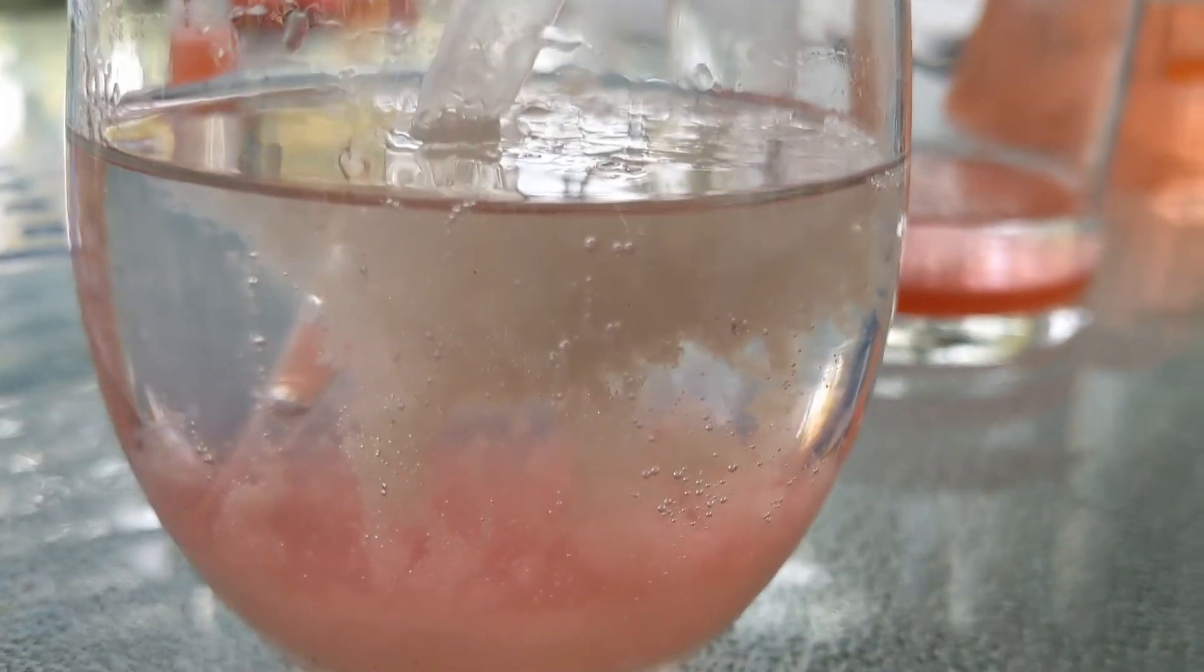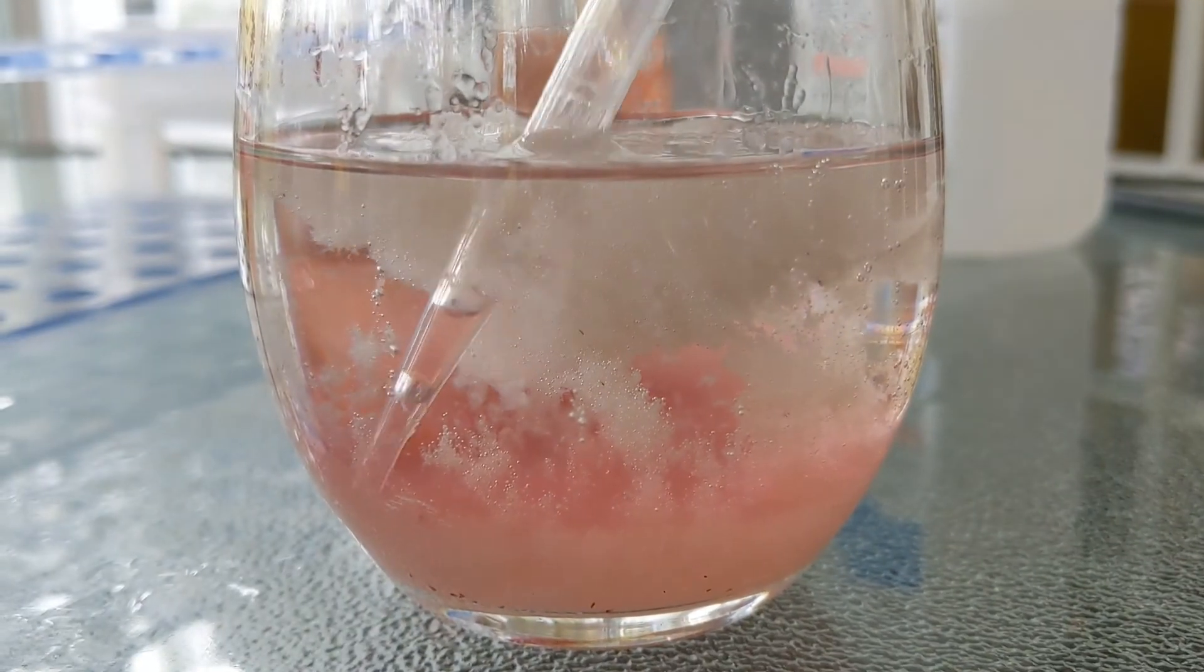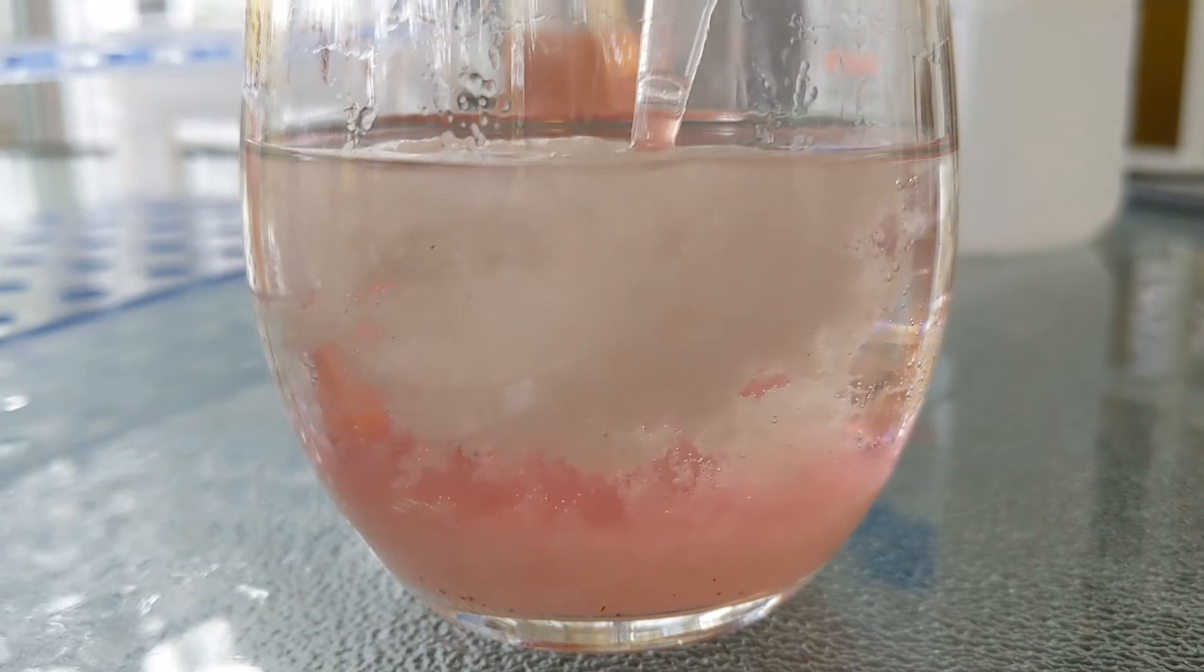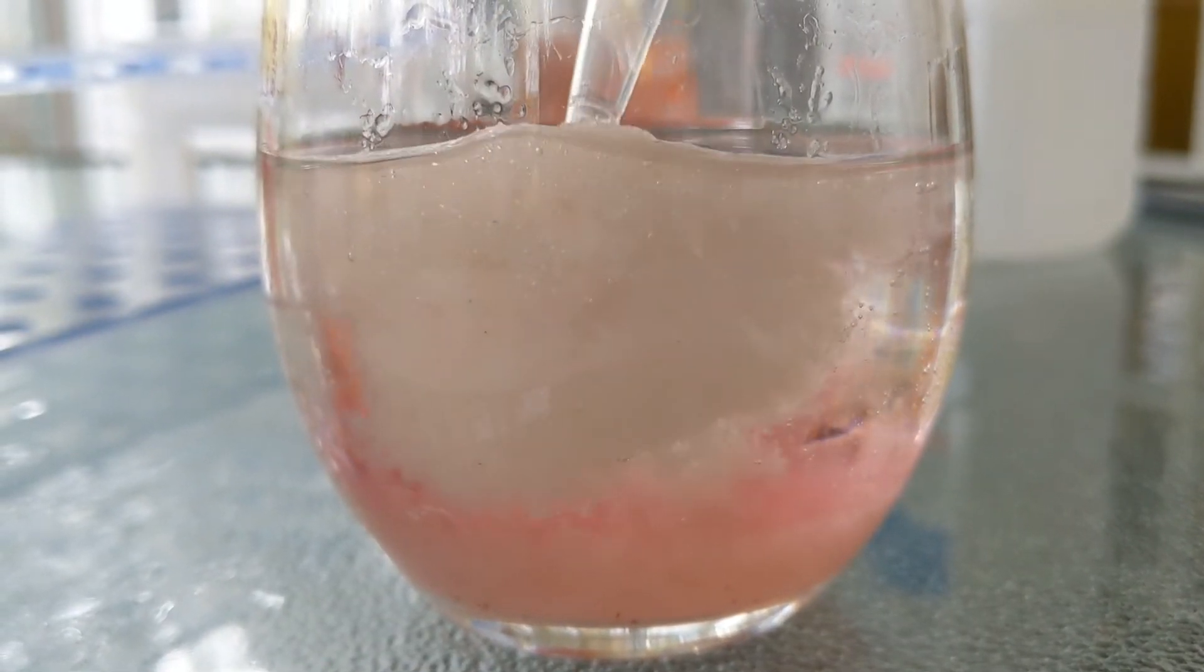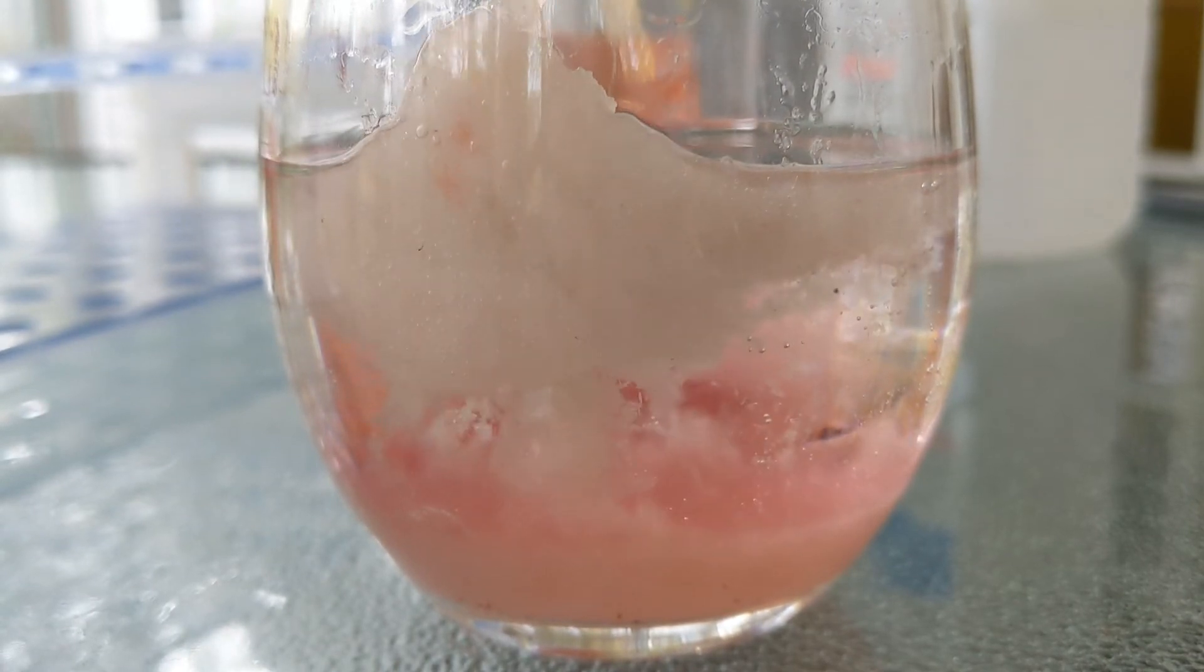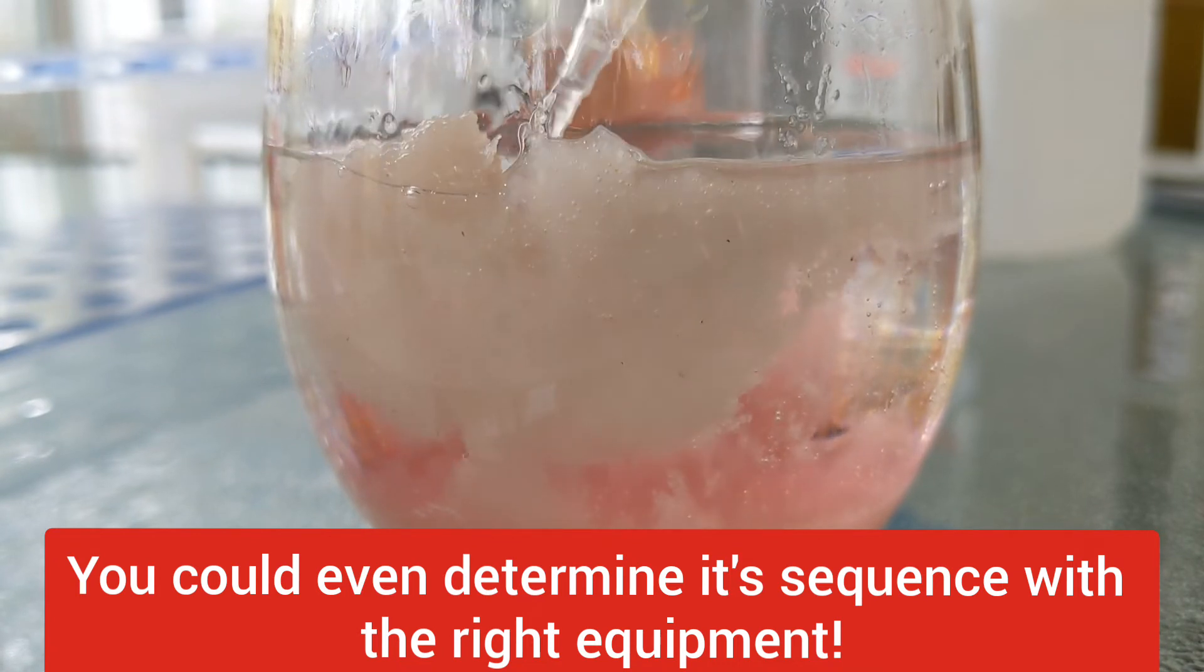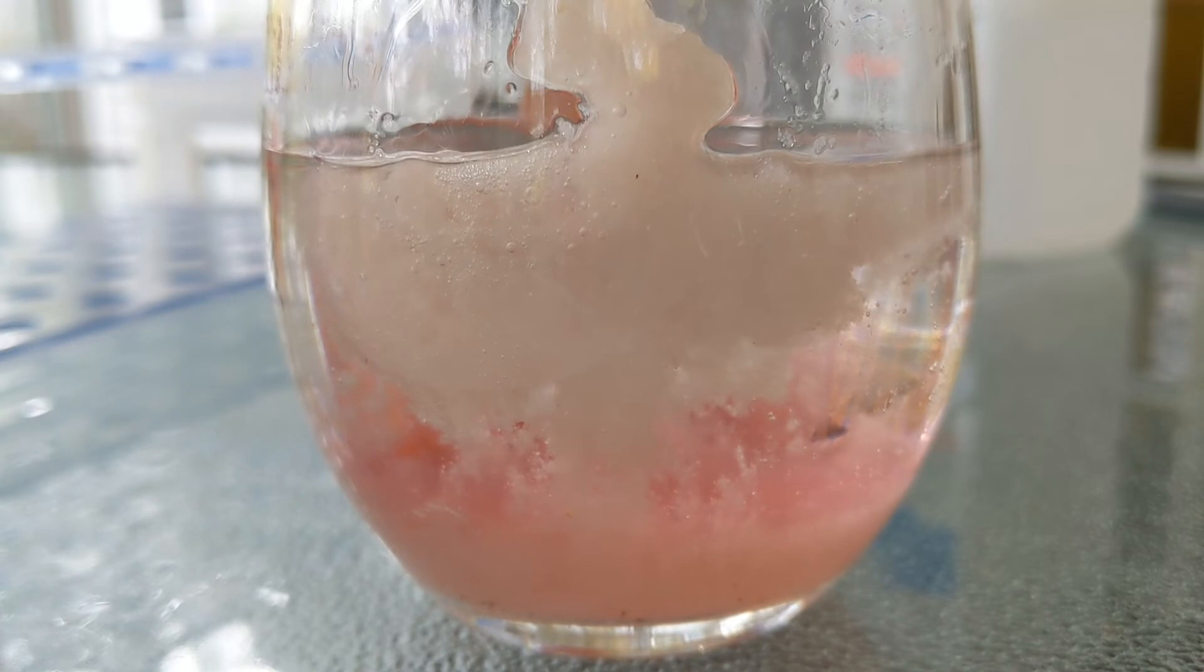It is white and stringy. And all of this in here is made up of A's, C's, G's, and T's. You can take a little bit of this and put it in a microcentrifuge tube or something else and wear it as a necklace.